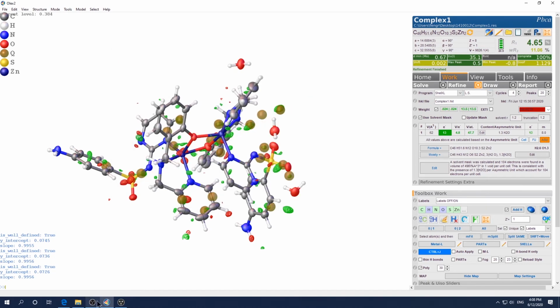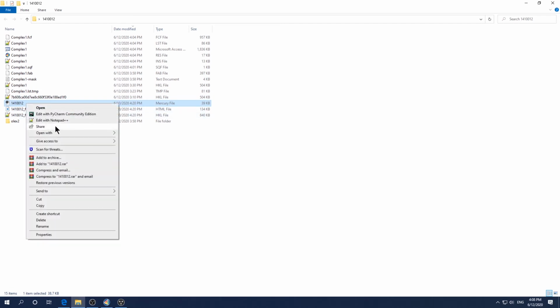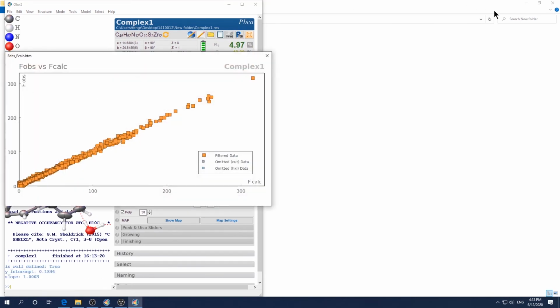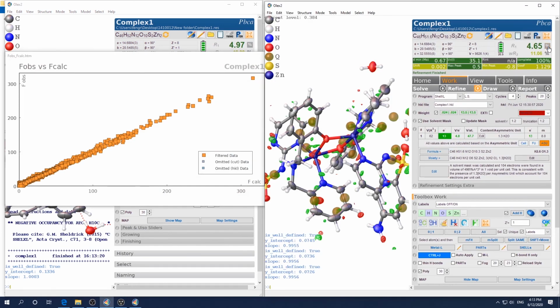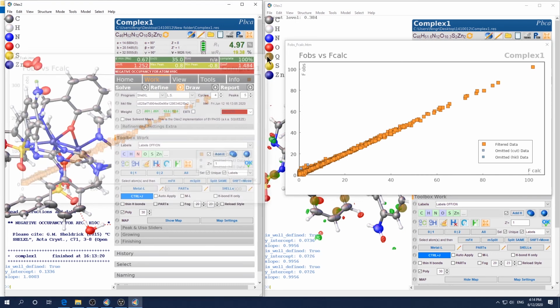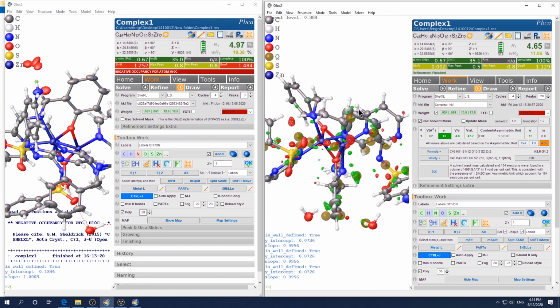So now let's compare with the previous result we downloaded from the CCDC database. Okay, so I believe I closed that window, so I'm going to reopen it with Olex2. Anyway, let's see if I can show this. Yeah, okay. Let's show this one here. Okay, so if you compare side by side, this one is apparently tighter, right? This one, the right side one, is the one where we just went through the whole process of reproducing the refinement. This linearity is much better, much thinner, much tighter. This other one is very noisy, right? So that means we did a pretty good job, and we know we did a good job because the model is now clean. The model is better.